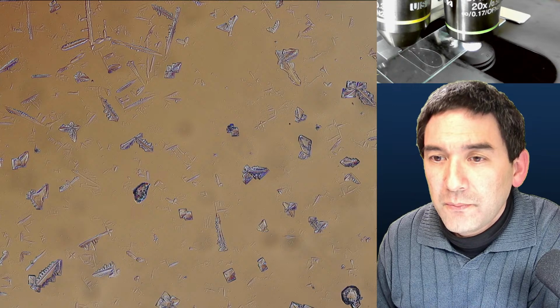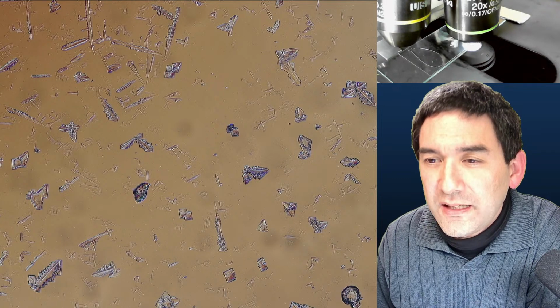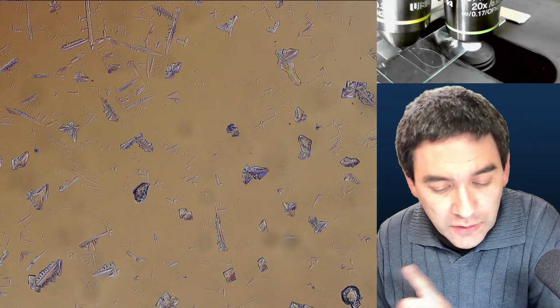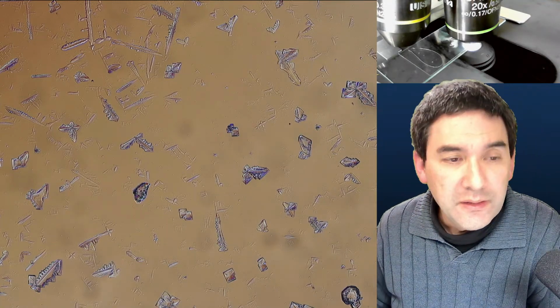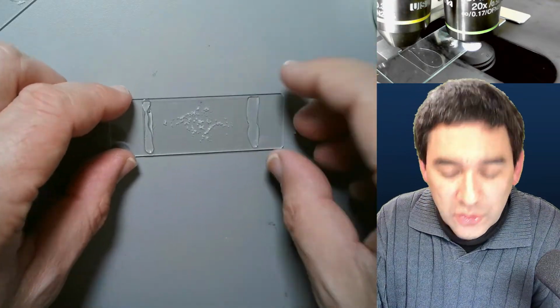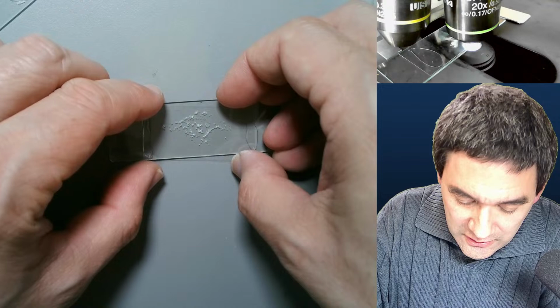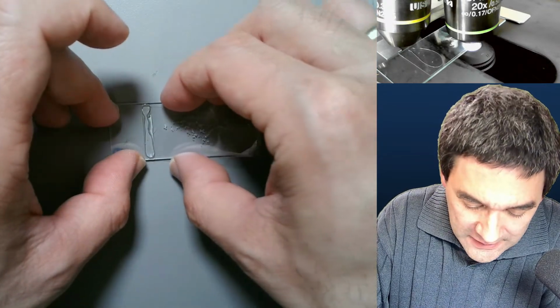Okay, so I'm just checking if there are some remaining questions. Would you seal a slide with blood with a nail gel too? I see no reason why not. Try it out. There is only one thing that I want to make you aware of, just as a last thing. The nail gel is not quite as strong as probably a nail polish. So if you use a little bit of force, it is possible to lift it off again.